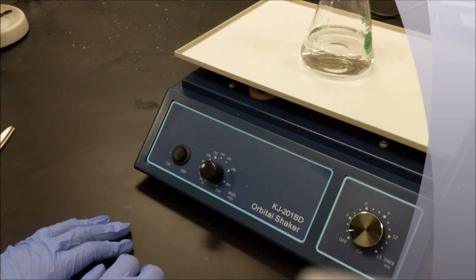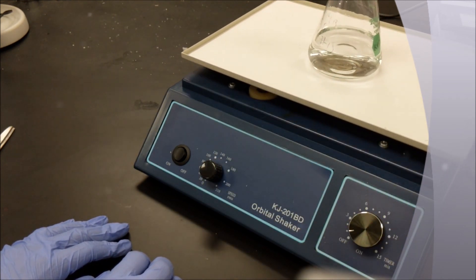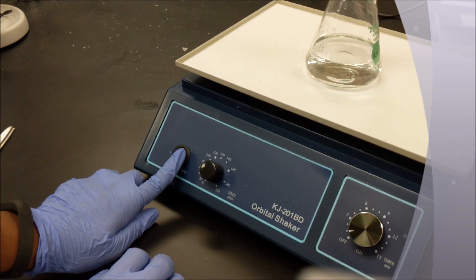Do not force the timer to zero. If you want to stop the shaking completely, you may simply press the off switch.